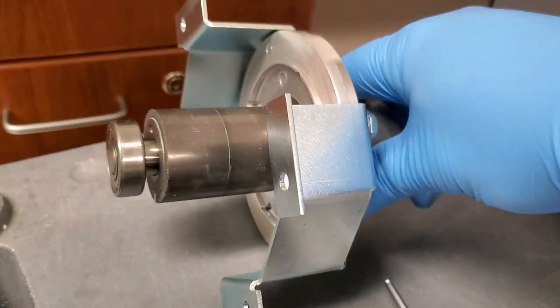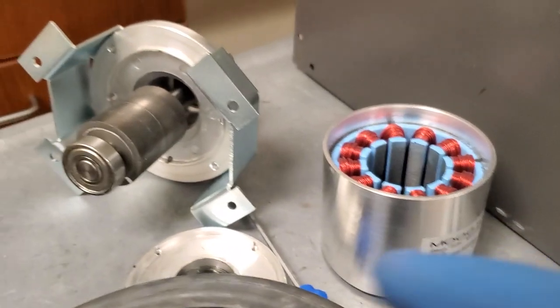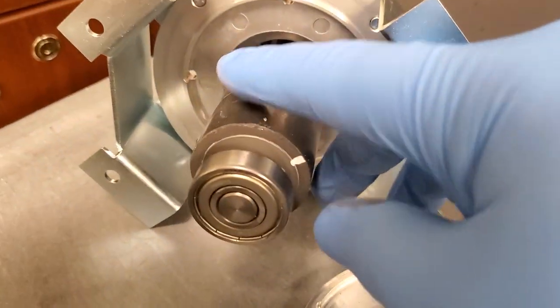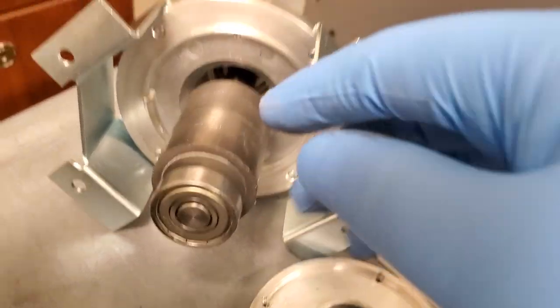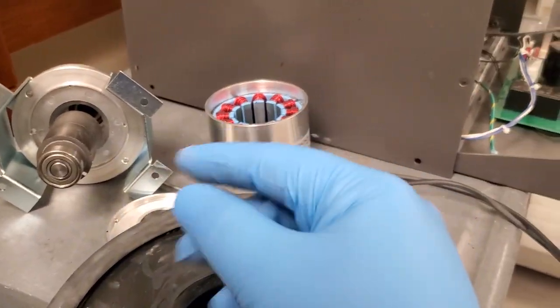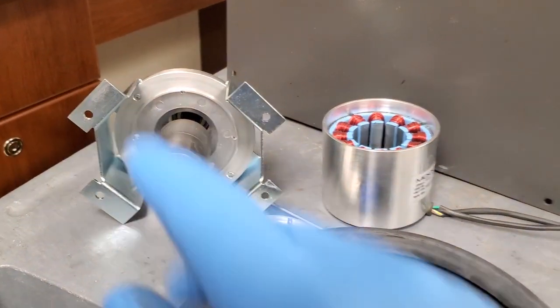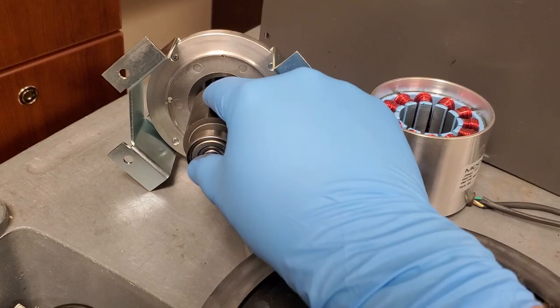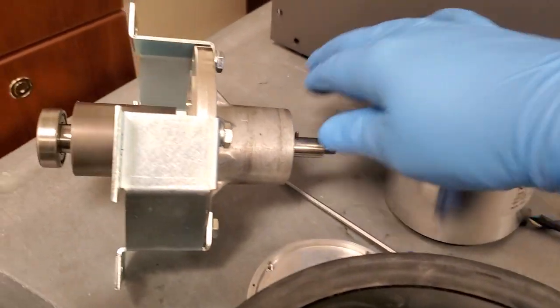Well, over a period of time, it does wear it down. It will still run, and it'll sound really grindy. You can see right here, parts of the magnet have already snapped off. And whenever a particle breaks off of a magnet, it develops its own north and south pole, so it sticks to everything. And that's unfortunate. So this one here has a bad motor.